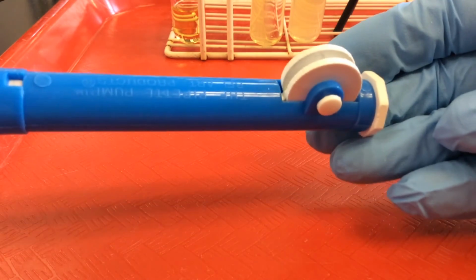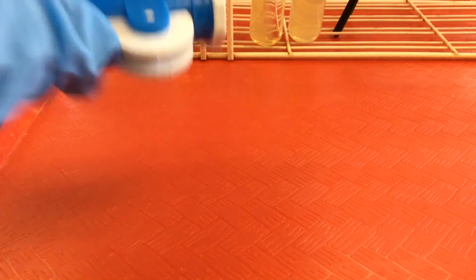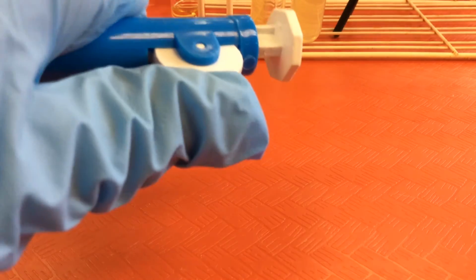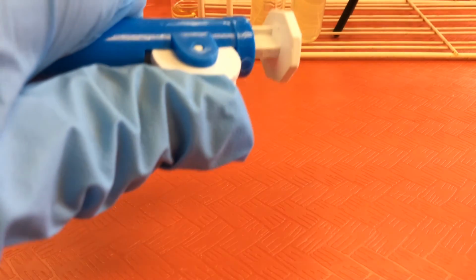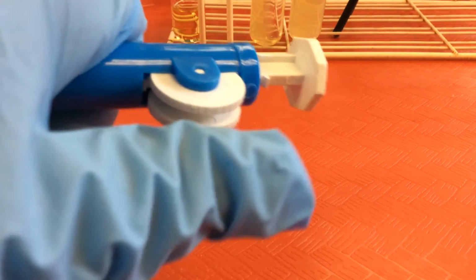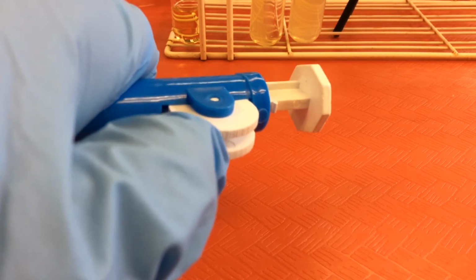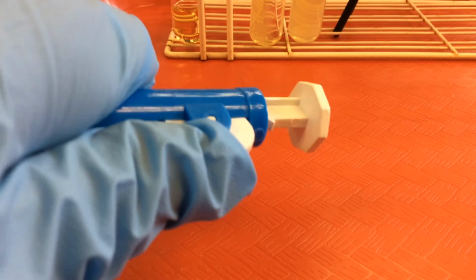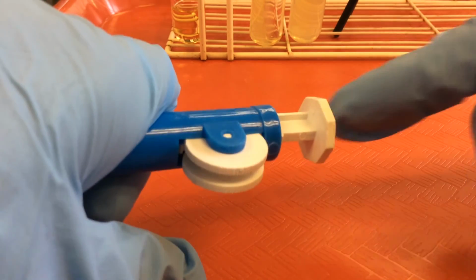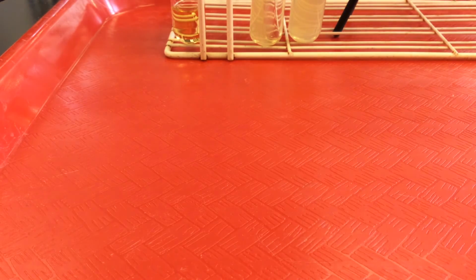So then if we're going to create a vacuum to draw up fluid, what we're going to do is rotate this knob. We will have immersed the tip of our serological pipette into a liquid. We'll rotate this knob. That will create the vacuum that will help draw up fluid into the pipette. And then when we want to dispense or deliver the fluid, we can reverse the direction that we rotate the knob, or if we want to deliver it all at once, we can simply press down on the plunger.